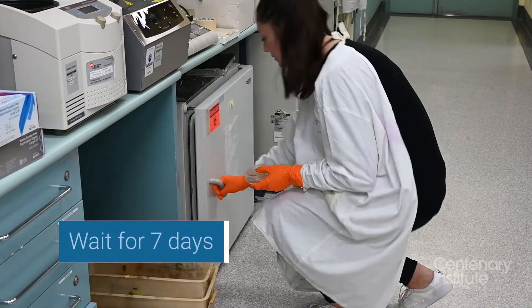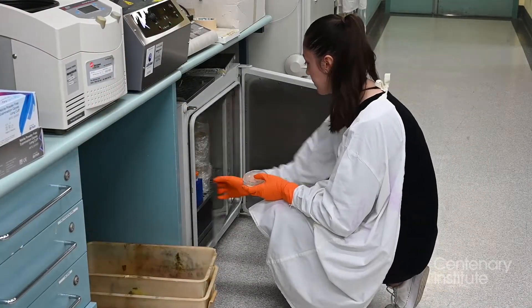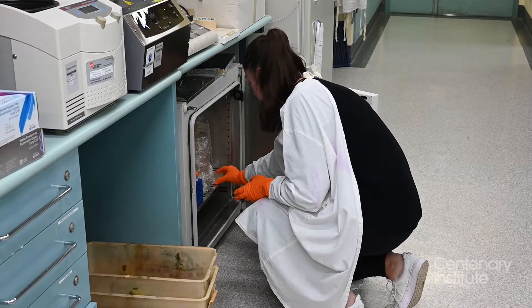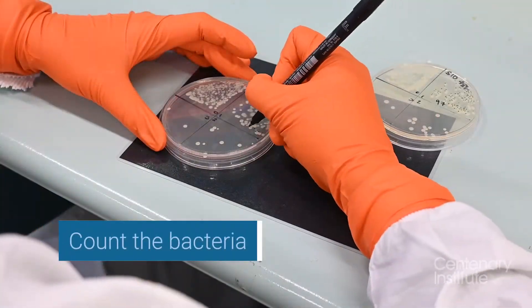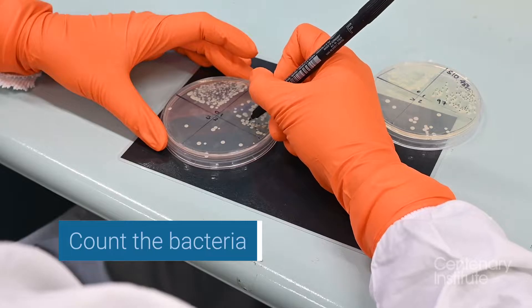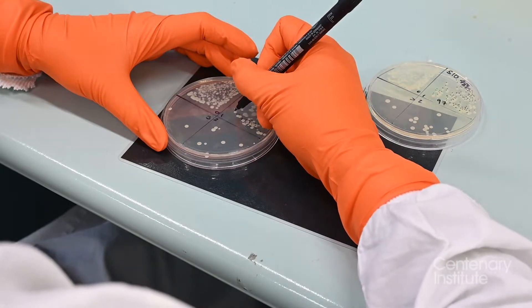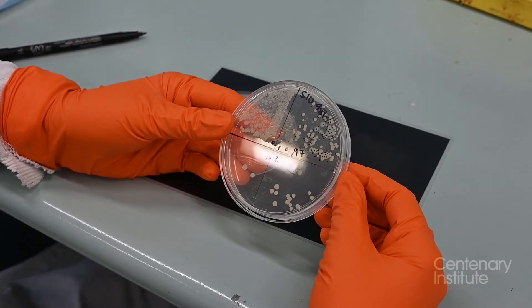Now it's back to a different incubator and we wait. After seven days we count our results. Each white blob represents a bacterium and we're looking to see whether the drugs have reduced the bacterial growth.